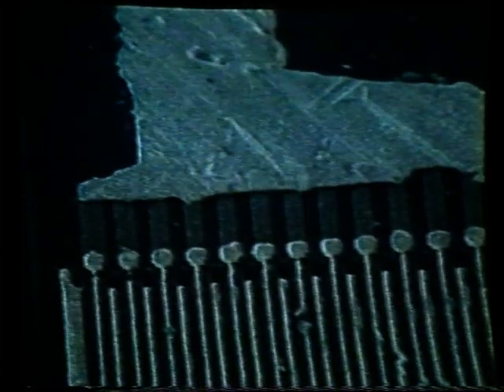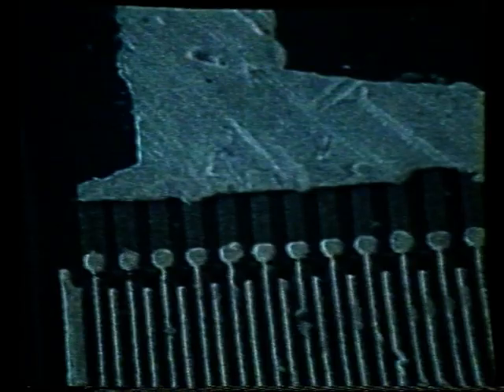We can also once again sharpen the focus using soft key number 10. This is a coarse focus using soft key number 10. We also have a fine focus control knob, which is located at the right of the tabletop where the keyboard is sitting, where we can go out of focus and bring it back into focus in order to more accurately define where the focus should be set. Again, that's using the fine focus knob located at the right of the keyboard tabletop.